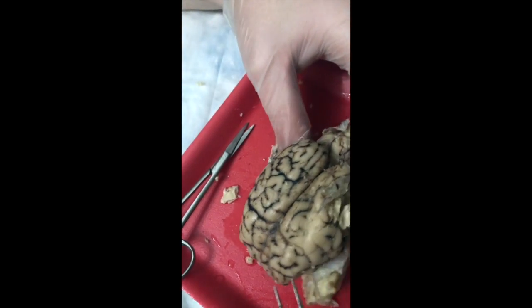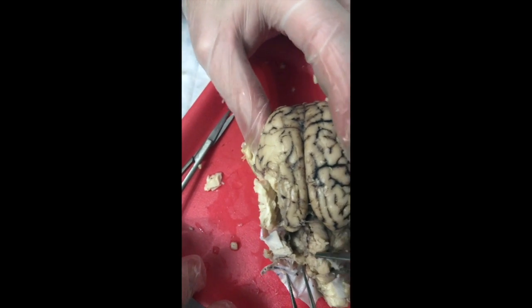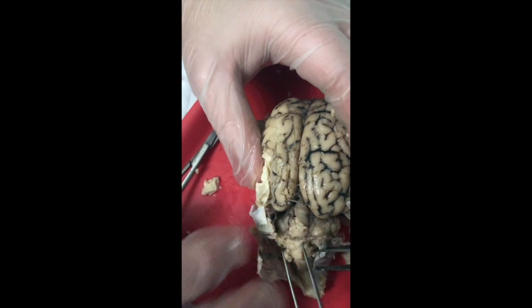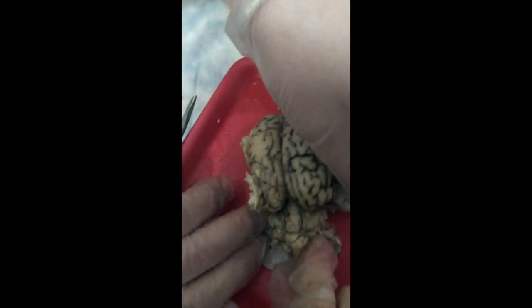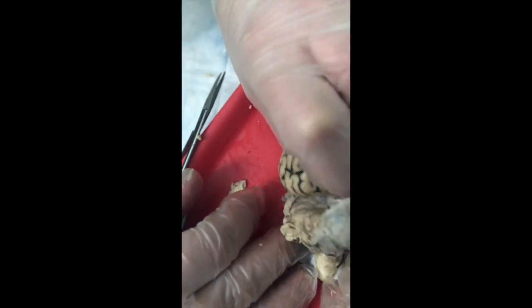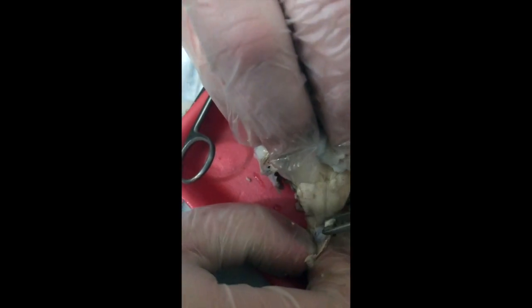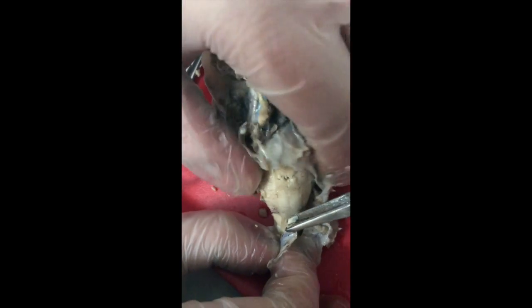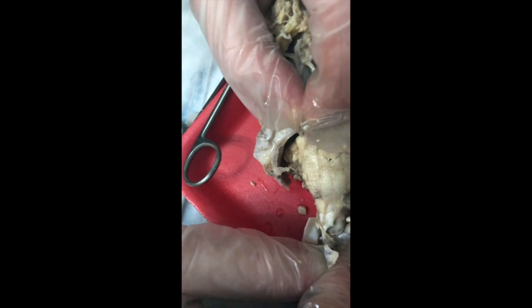Okay. Turning around, looking at the posterior aspect, we see the walnut-shaped cerebellum hanging off the posterior and inferior aspect. Flip it over. Why do you have that light? Let me flip it twice. On the inferior aspect, we have the pons, the swelling of the pons visible here, going down into the medulla and then the spinal cord.